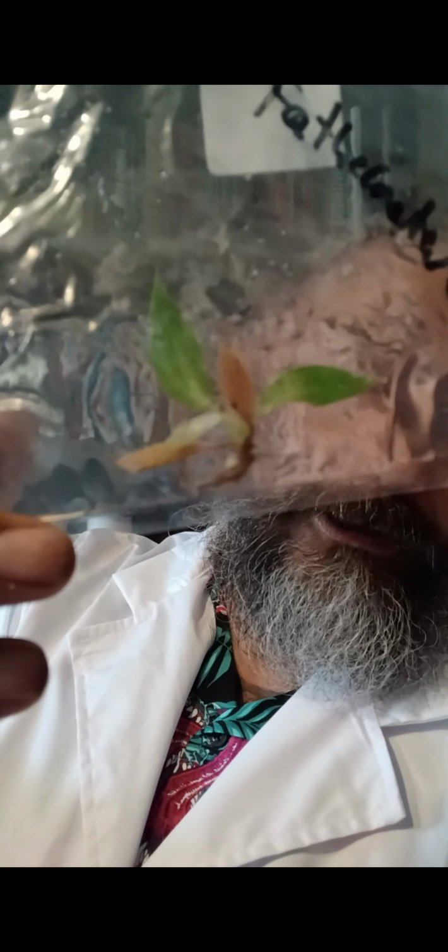Beautiful. So how do these contaminants happen? Where do they come from? That is the question that we always ask. Many of these came from TCs that were ordered from other sellers or ordered from overseas and then put into multiplication. And you wonder to yourself, well, they were clean in the baggie. They didn't look like there was anything wrong with it. They may have looked something like this, right? Where all you're looking at is a tiny little plantlet in a clear gel.